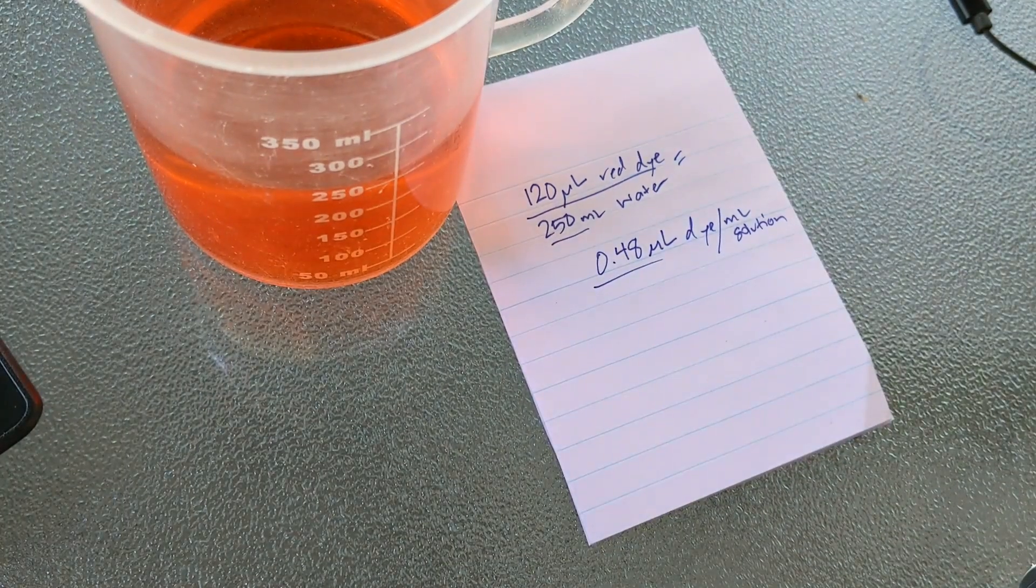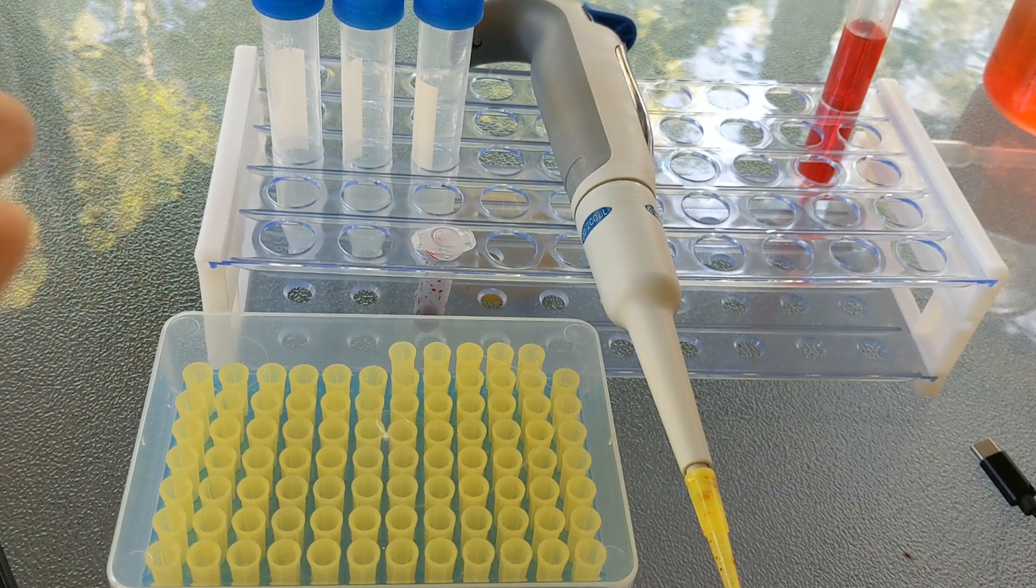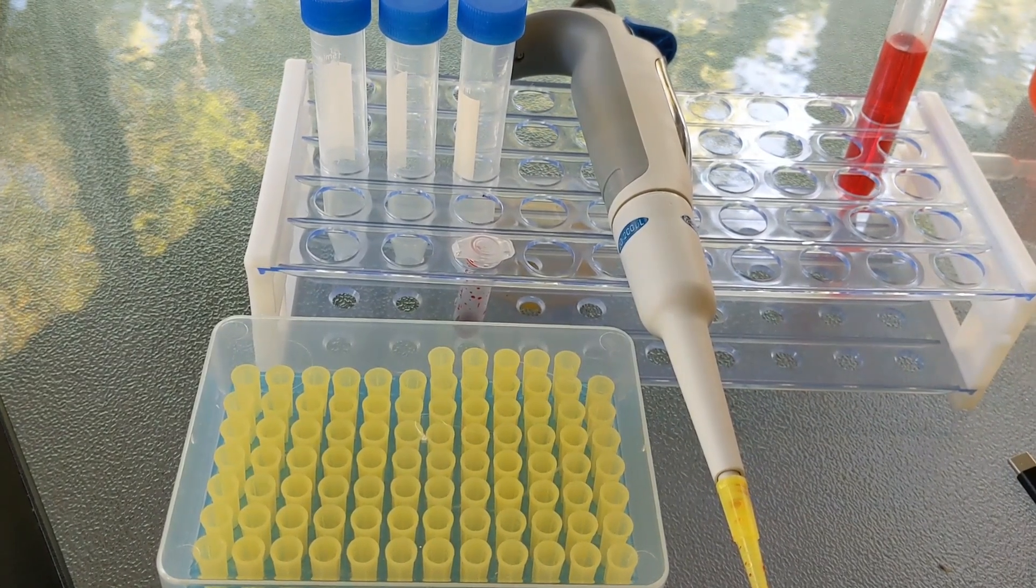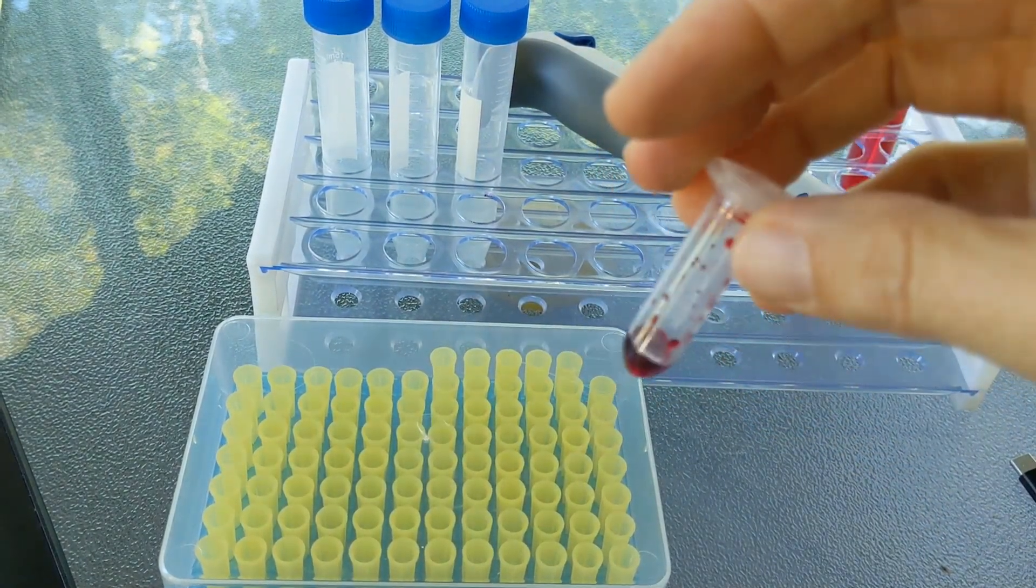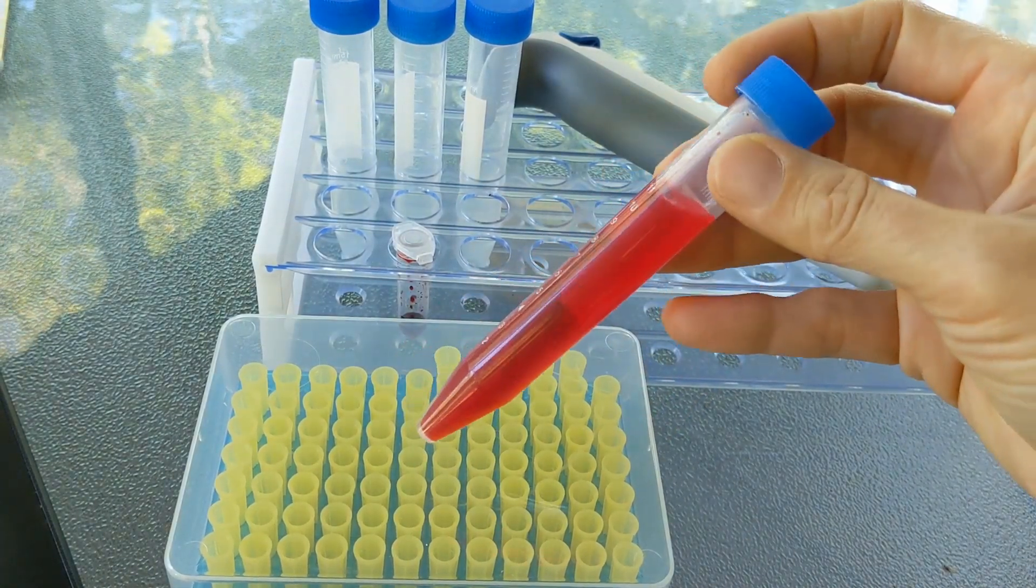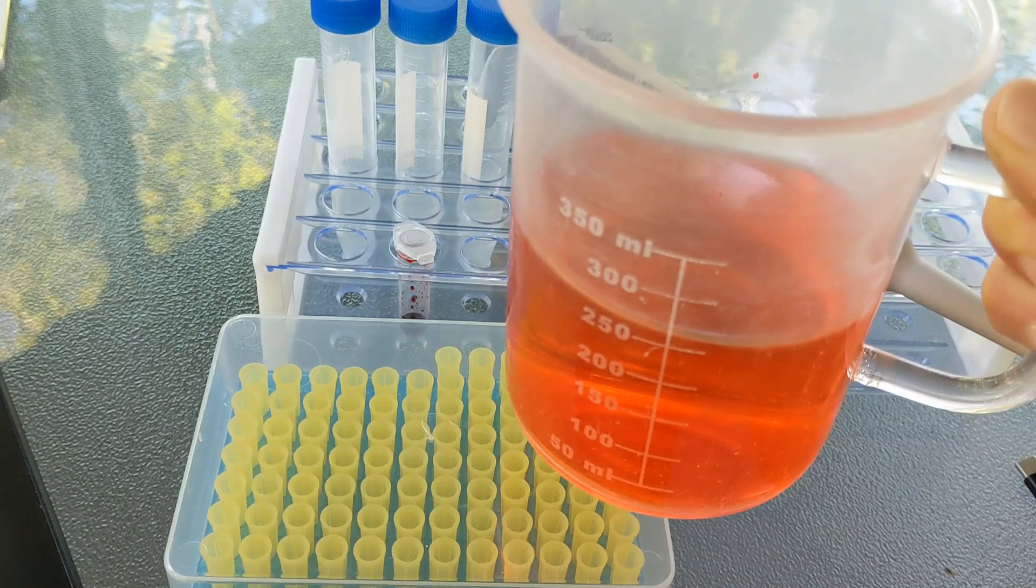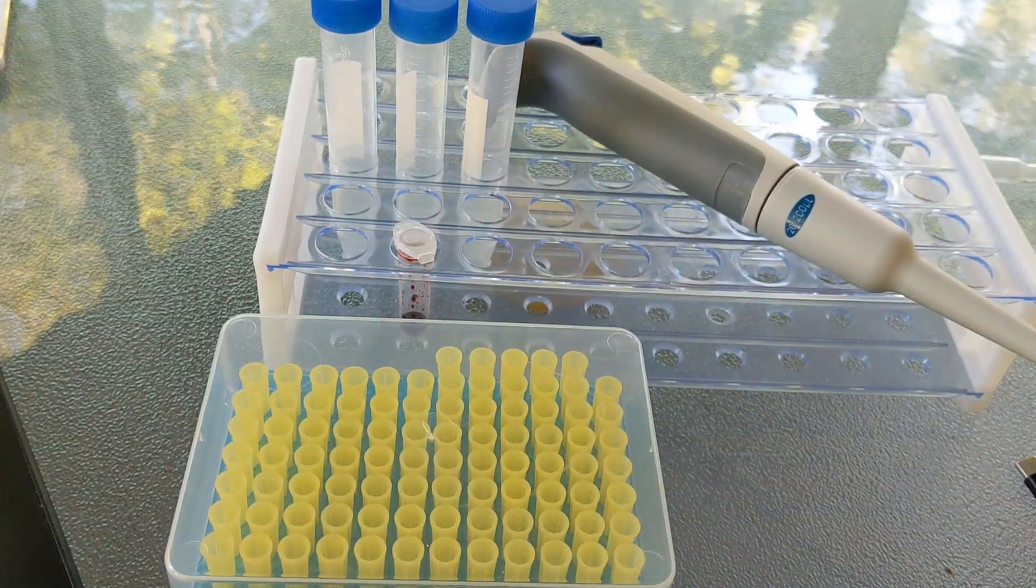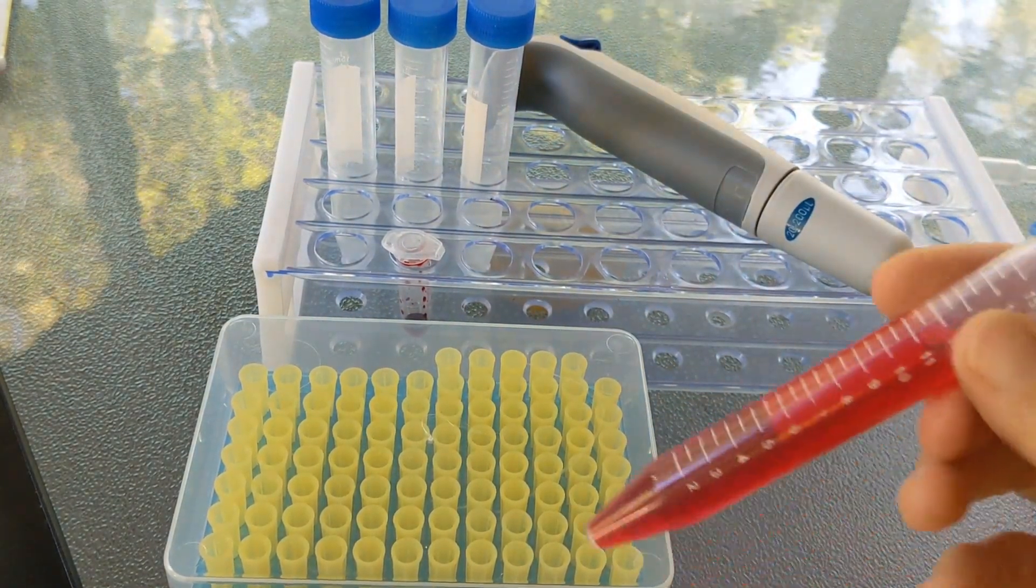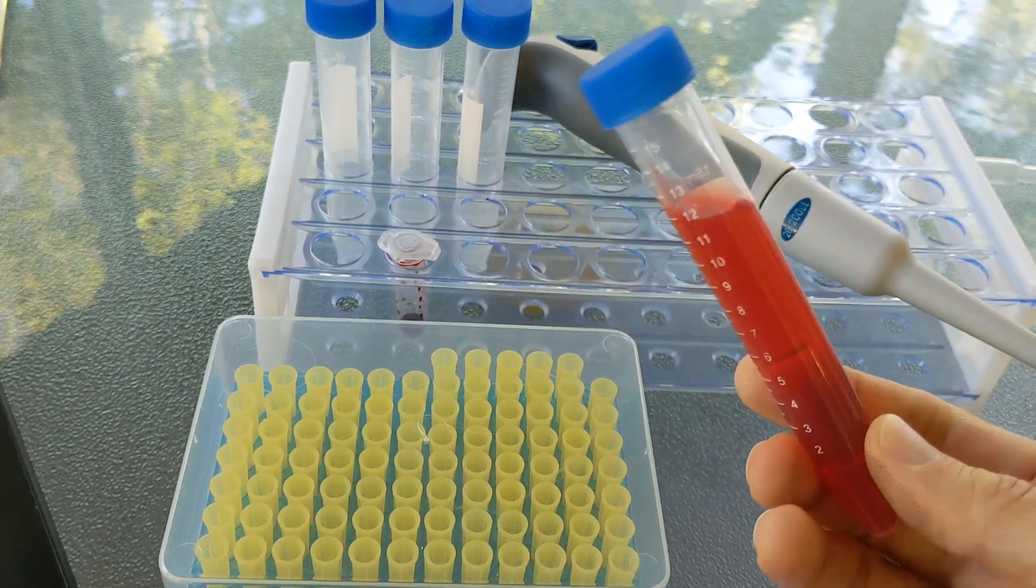The next thing is to get ready to do this lab with your students. I don't give my students very many supplies to do this lab. I basically give them a few tubes, maybe three or four tubes. I give them a micropipette and tips. I'll often give them both sizes of micropipettes so they can decide which one they want to use. They get a little vial of the red dye. I wouldn't actually give them nearly this much. I would probably give them a total of 500 microliters each. And they also get a sample of the mystery solution. Now I don't usually give them the mystery solution in the same containers they get. So probably what I would do is put it in a big beaker in the middle of the room and then wait for kids to say, hey, can our team get some of that out of the beaker? Or I might put it in a tiny microtube like this because I like the volume of the mystery solution to be a little different from the volume they're making. The reason for this is that the kids tend to have the idea that you have to have the same total volume of a solution to get the concentration to match, and that's the biggest misconception of this lab.